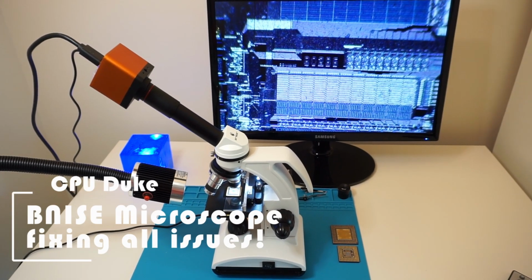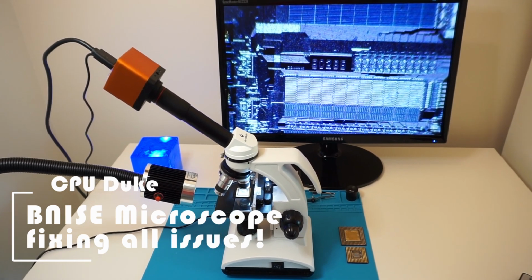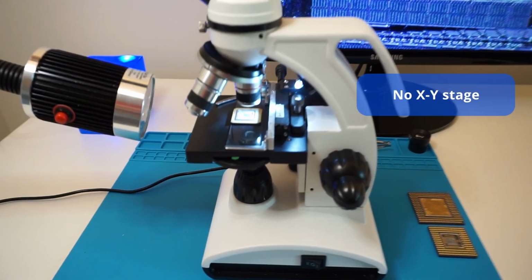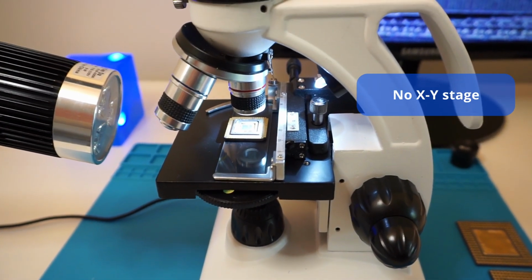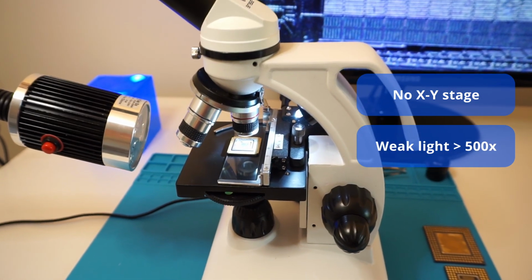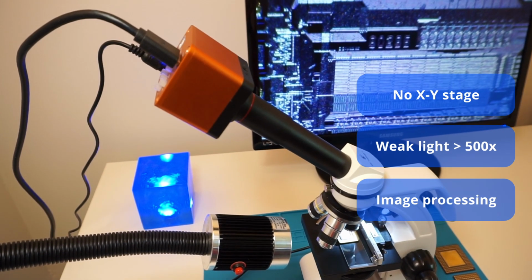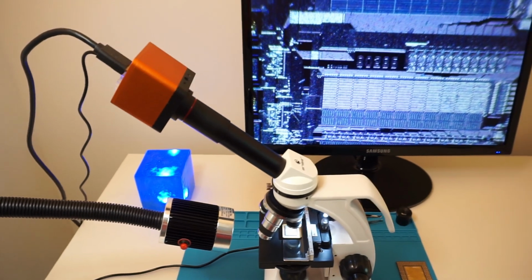So as I said, there were 3 deficiencies of the microscope system, which I in the meantime could cure. Just to repeat, there was one issue navigating the object to be observed. The second one was the light intensity at high magnification. And the third issue that I saw was how to get a decent picture out of the microscope. So here I would like to present you the solution that I have now.